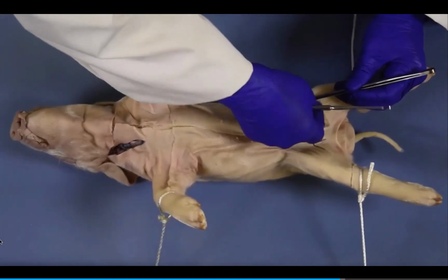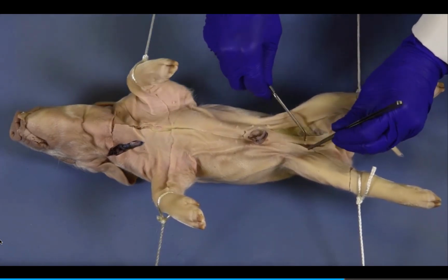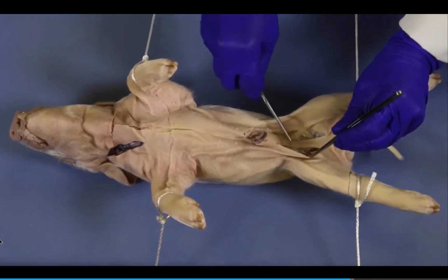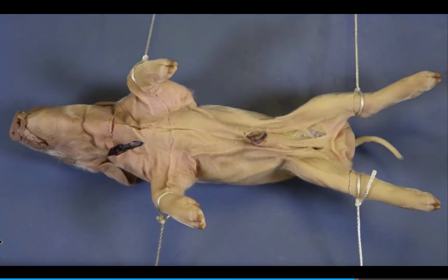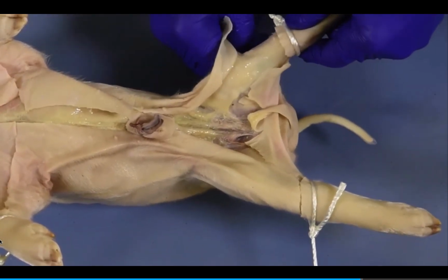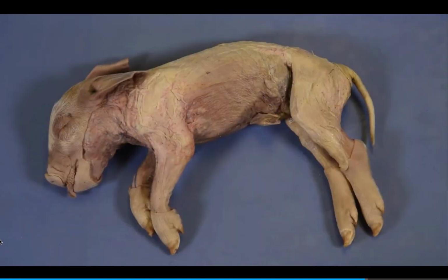To remove the skin, use the blunt probe to tease the skin away from underlying muscles. Begin at the posterior end of the fetal pig, where the underlying tissues are less delicate, and work toward the neck. You will tear the cottony connective tissue fibers as you remove the skin. Work from the ventral surface around the lateral surface toward the dorsal surface. Pull the skin over each limb. Remove the skin from the last limb and gently separate the skin from the fetal pig.